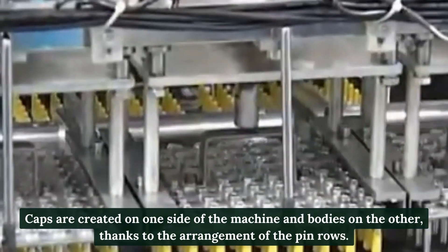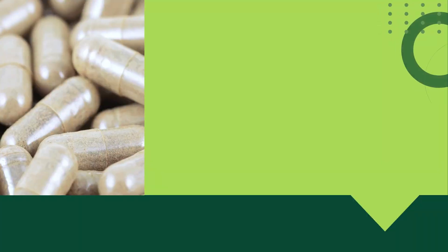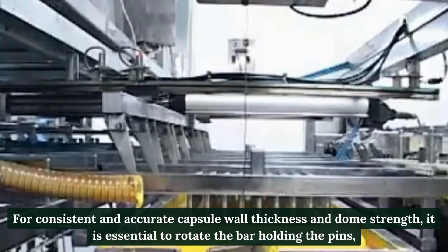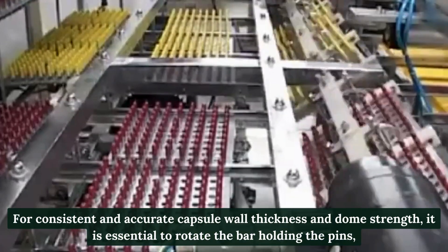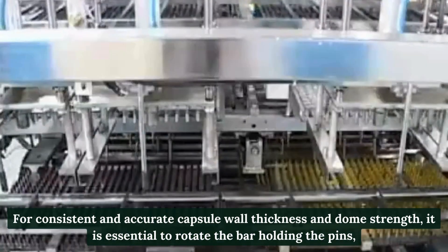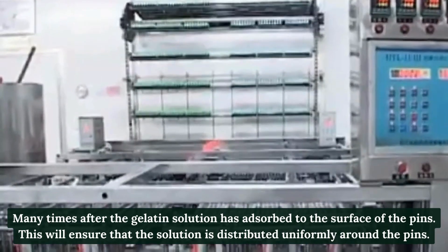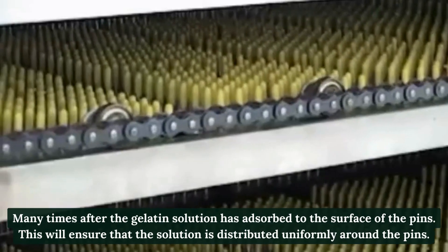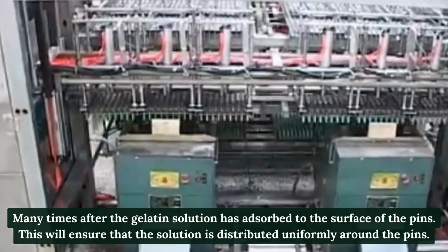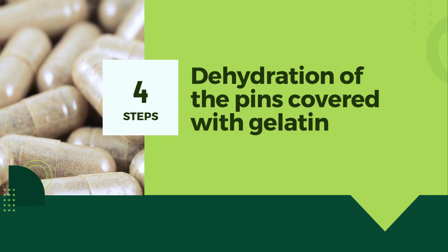Step 3: Rotation of the dip-coated pins. For consistent and accurate capsule wall thickness and dome strength, it is essential to rotate the bar holding the pins many times after the gelatin solution has adhered to the pin surface. This ensures the solution is distributed uniformly around the pins.